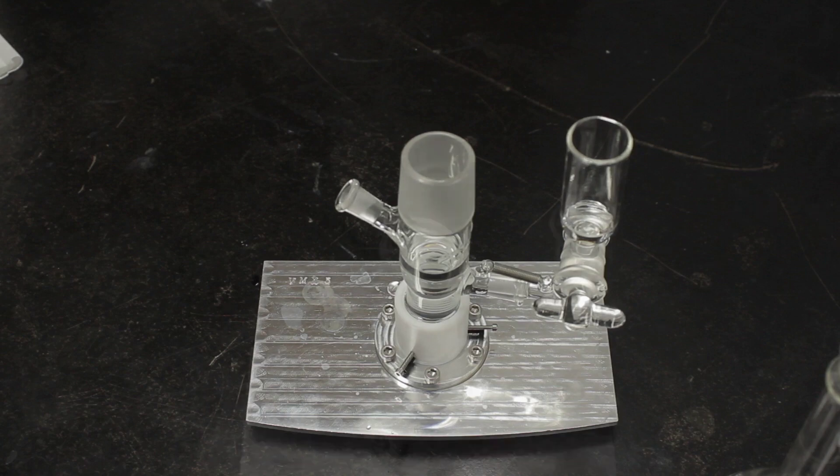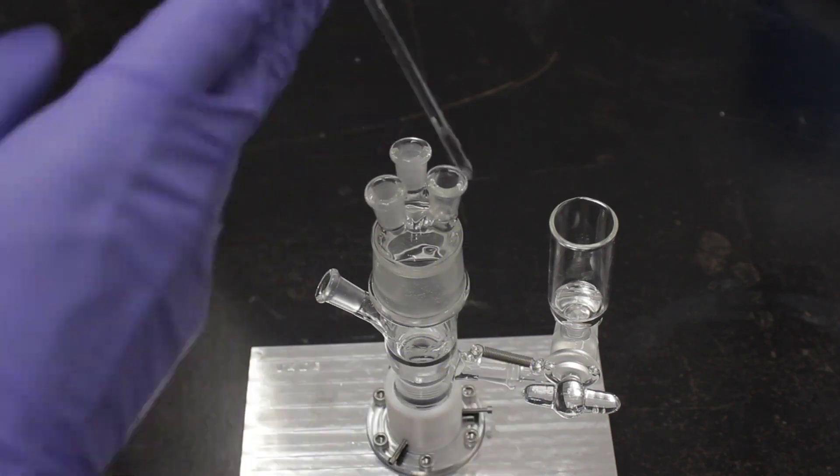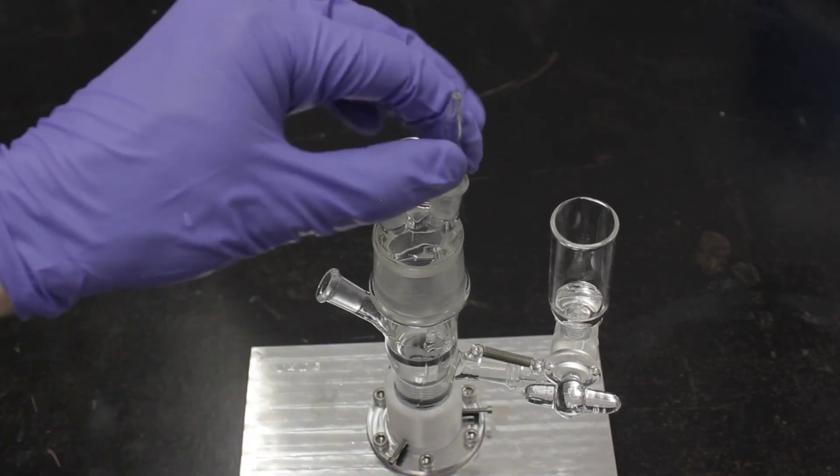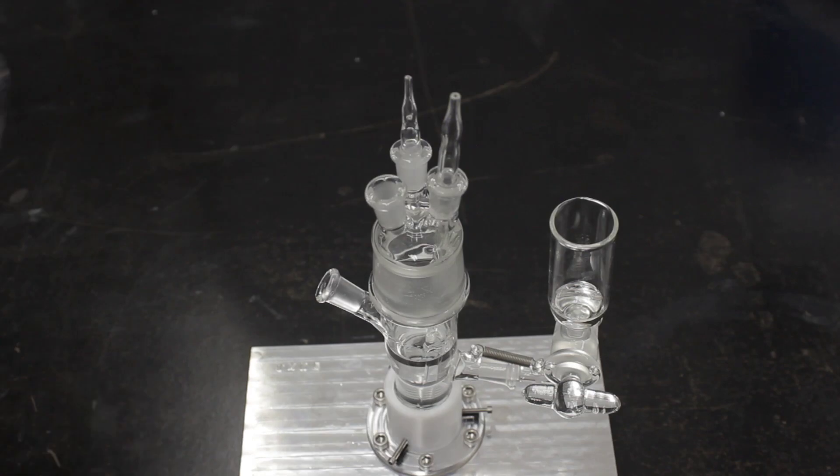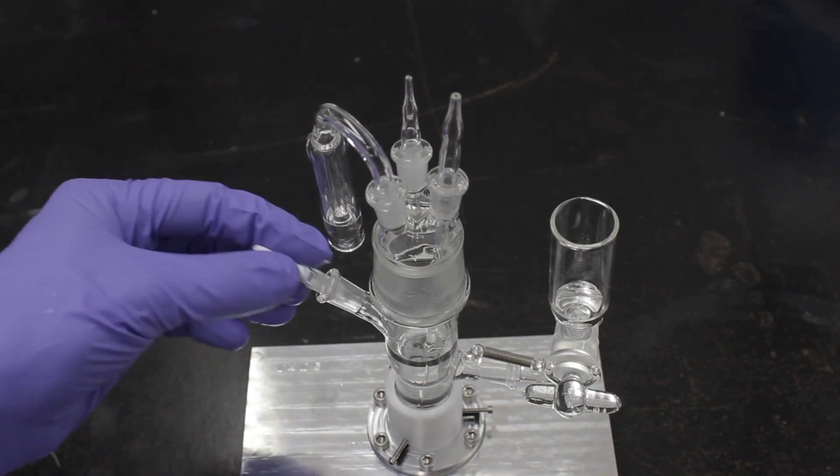Next, install the top cap with the ports. The long bubbler should go in the port indicated by a glass nodule. The short bubbler and the gas trap are installed next. Finally, the counter electrode is installed and the reference electrode is placed in the reference arm.